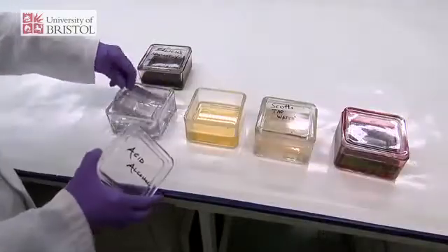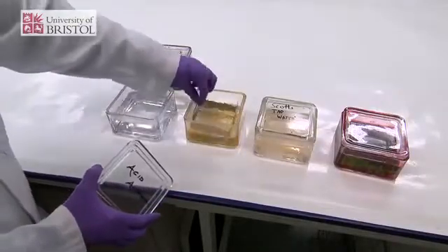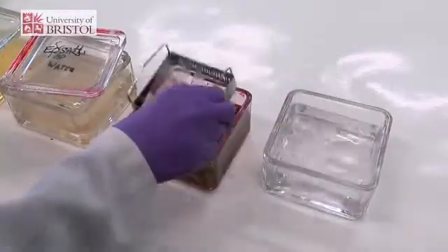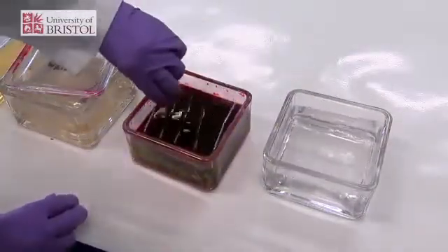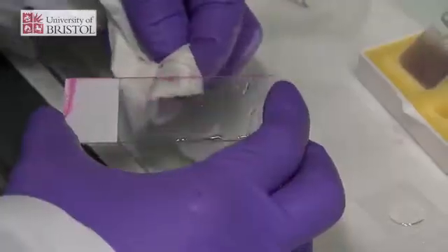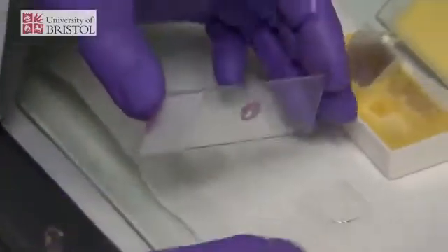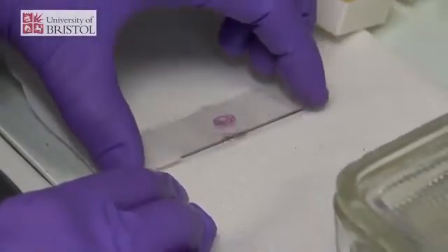We stain tissues with a variety of different dyes and colours because they have different properties, and different dyes will stain different parts of the cells and the tissue. This enables us to use the appropriate dye to illustrate the part of the tissue or the cell that we really want to emphasise.